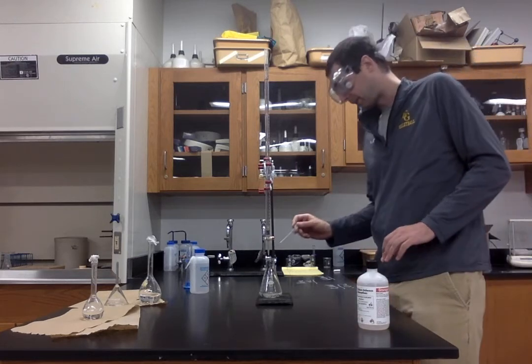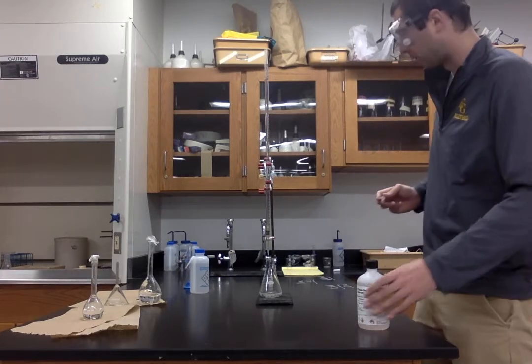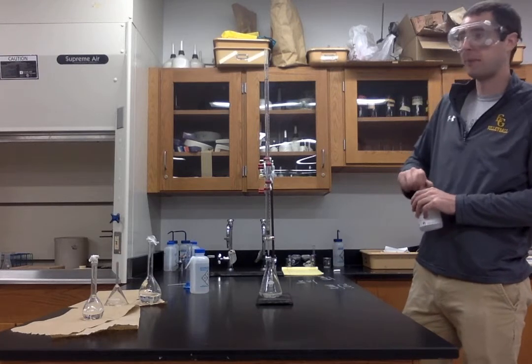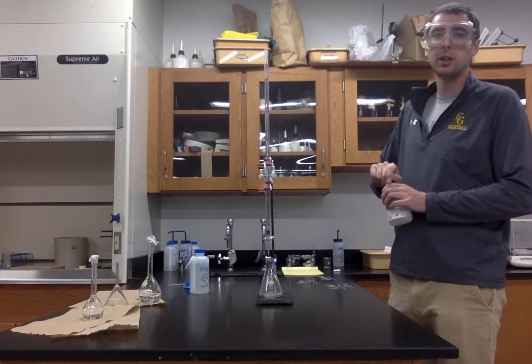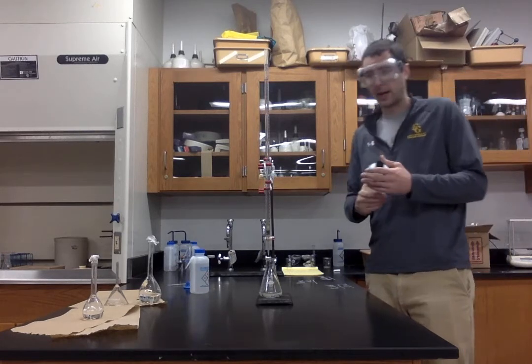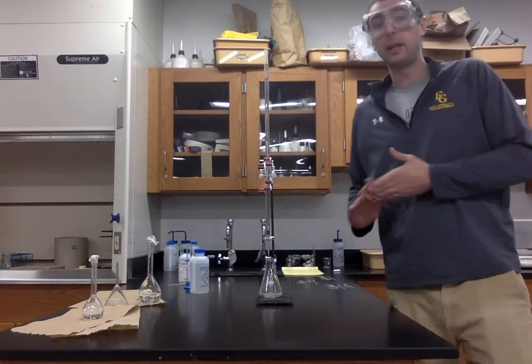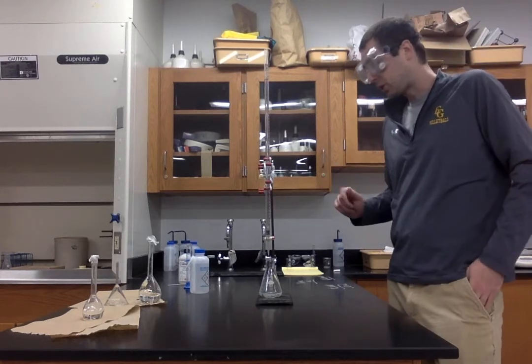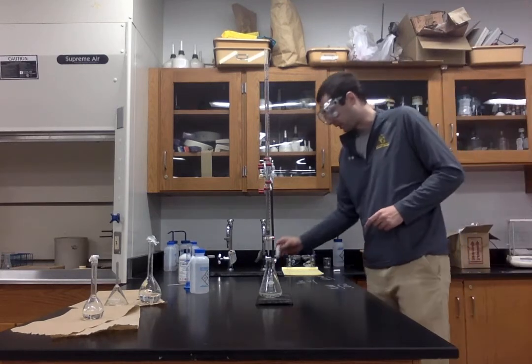So for this particular titration and indicator, I just added a couple drops into our acid, and we will see a pink solution form when the pH gets, I believe, above around 8. So phenolphthalein changes at about 8 to 10 pH. So when we get to the equivalence point, or just slightly beyond the equivalence point, we will see a change in color for our solution. So that's what we're looking for.